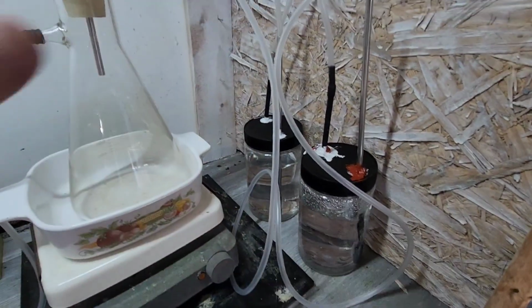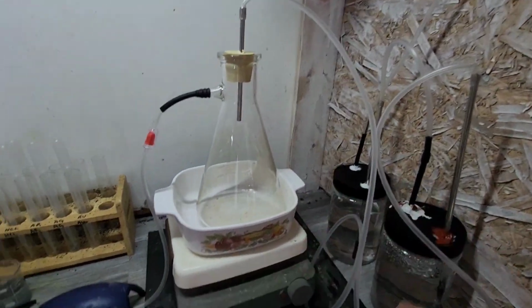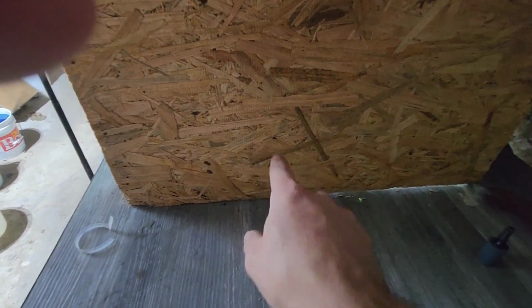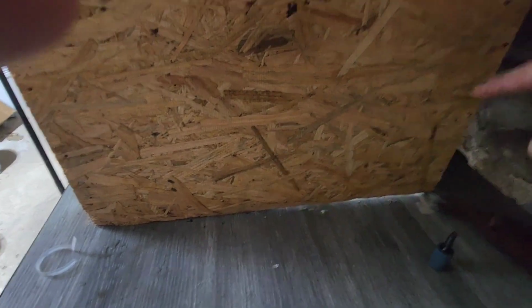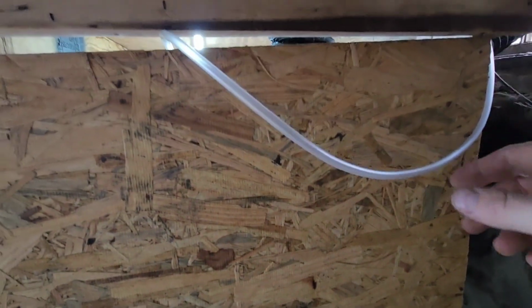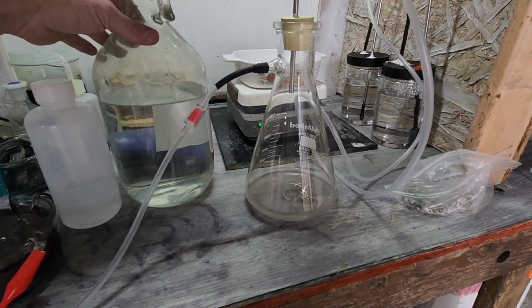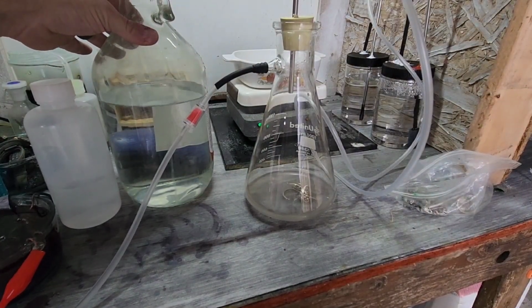Now, I left all this hose longer because where I want it to go when I'm all said and done with it is right here. I'll have a collector box here so they can sit in, and then when I know that it's 100% sealed, they'll come here, they'll get scrubbed, and then they'll come up. Like I said, right there. All right, in the meantime, we're just going to test this out. I got a little bit of stirring in there.